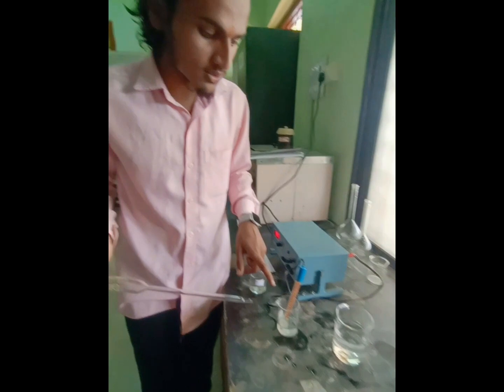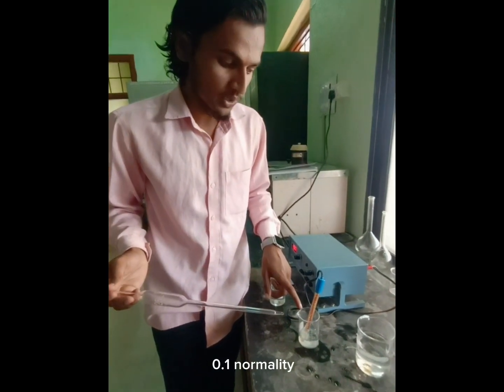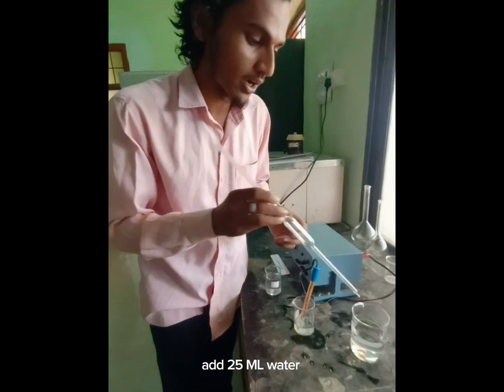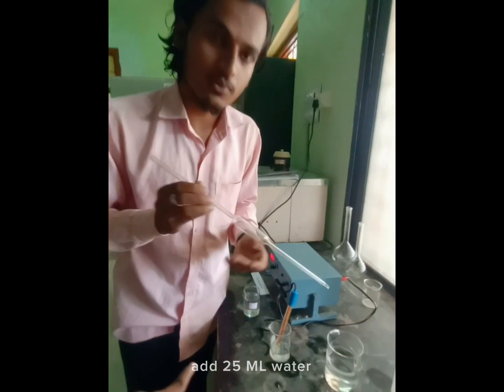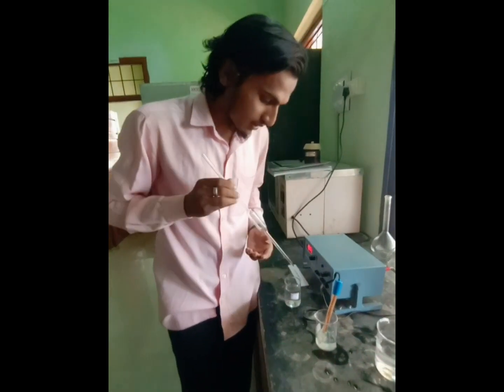To make this dilute to 0.1 normality, we have to add 25 ml of water into it.